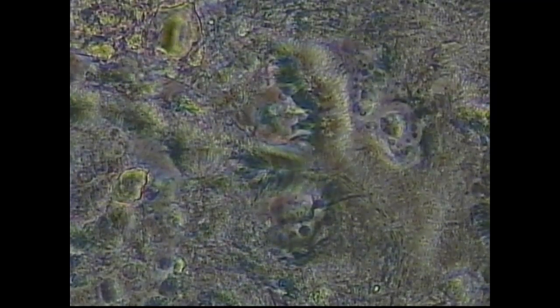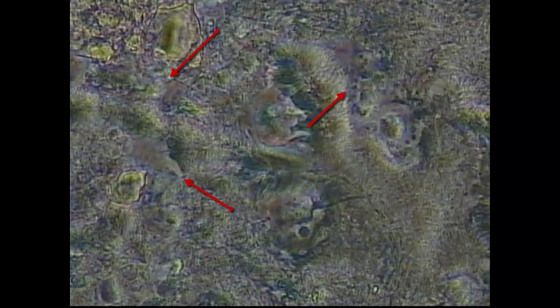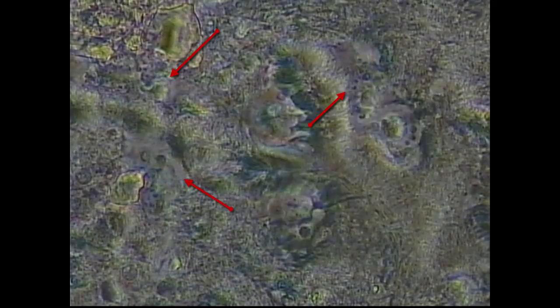Amoebas definitely do not belong in the oral cavity. They are indicative of a very advanced disease state. And you see this wave-like movement in some of these areas of the slide, and we're going to go to a higher power in just a minute. But in this frame, you can see 3 different amoebas in the same frame, and you can tell they're amoebas if you just look how they're moving through the plaque sample.